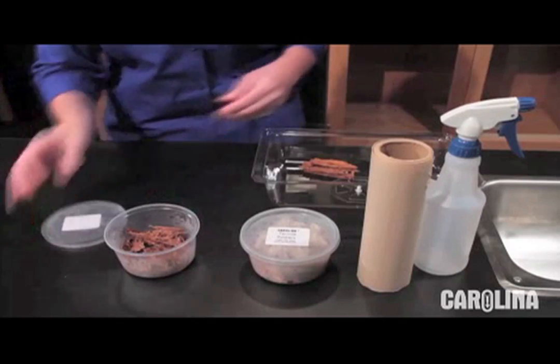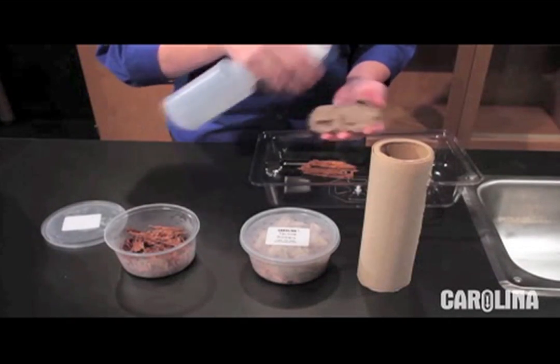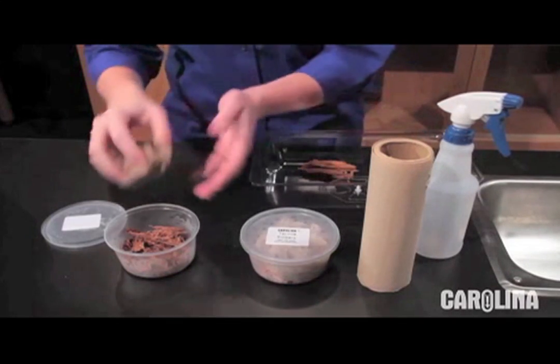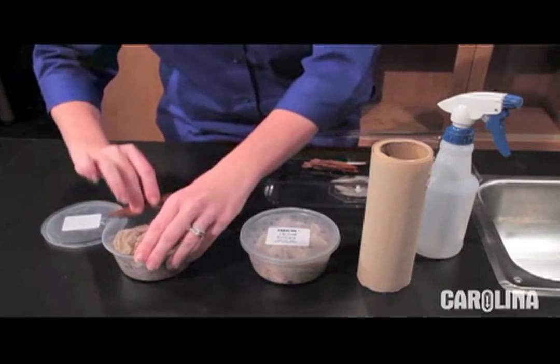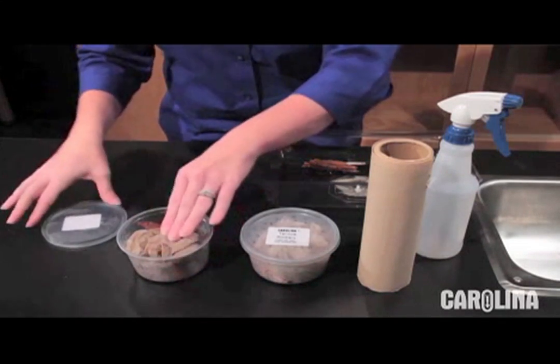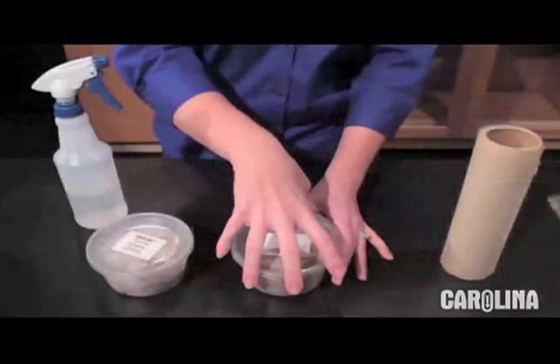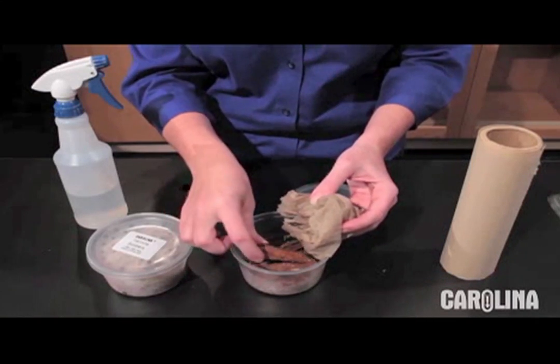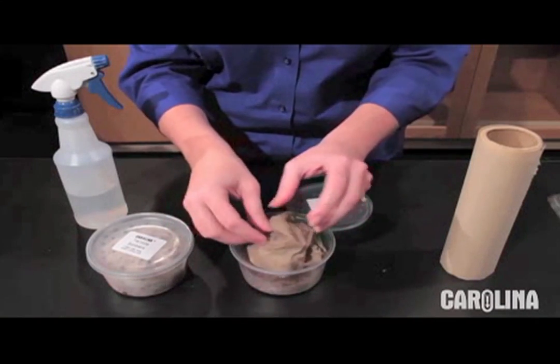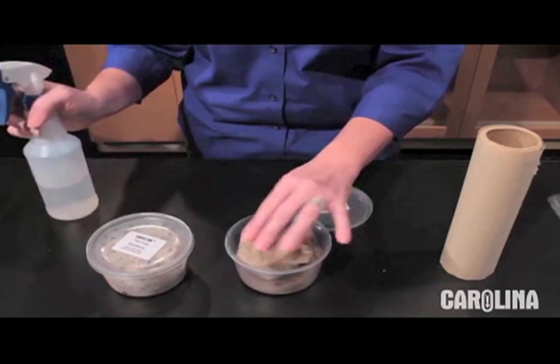Paper and wood, the termite's main diet, consists mainly of cellulose that is converted by the protozoa in the termite's digestive tract into digestible substances. Control of moisture is critical. A dry culture will soon die, and a water-saturated culture will mold, producing foul conditions that are unsuitable for termites. It is best to sprinkle a little water daily or as necessary onto the top of the paper to maintain a slightly moist condition. Check frequently to determine the moisture condition.